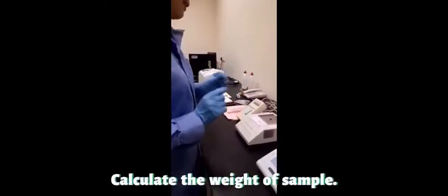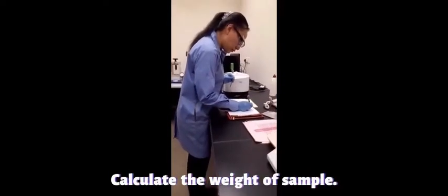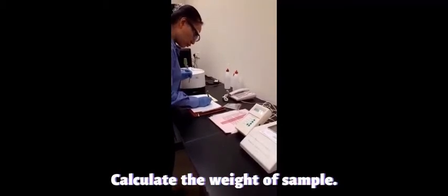After that, you need to calculate the weight of the sample. So the weight of the sample is 0.1568.